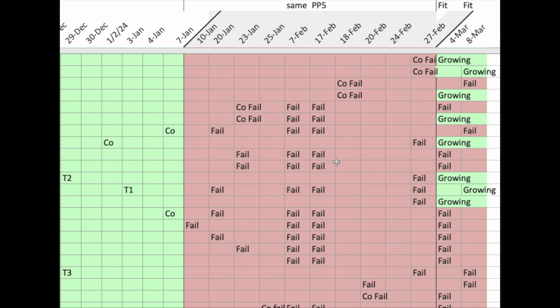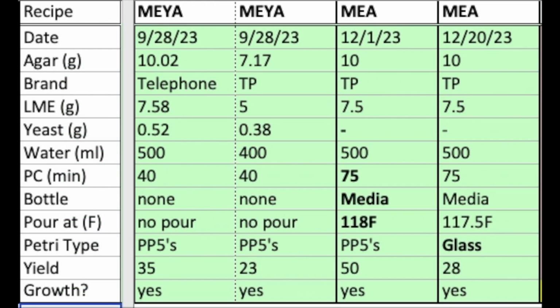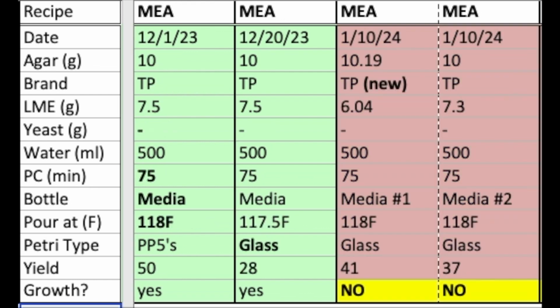In fact, I was grabbing the same initial transfer of material and moving it across different dishes, and it just wasn't growing at all. So after gathering all the information off of petri dish labels, I then turned to my lab notebook and looked for agar recipes, and I found that I'd made a double batch on January 10th, 80 plates of agar that, as it turns out, nothing would grow on.